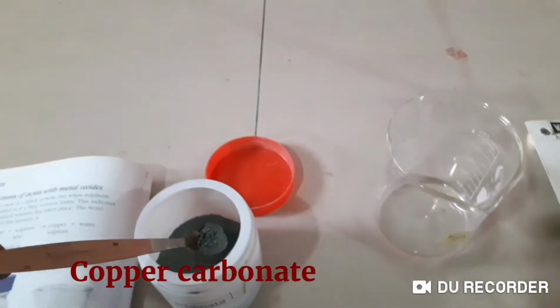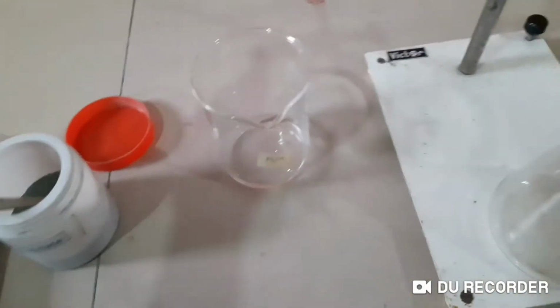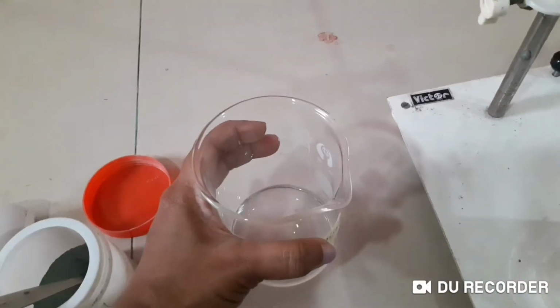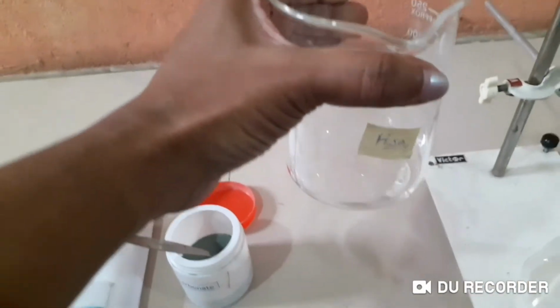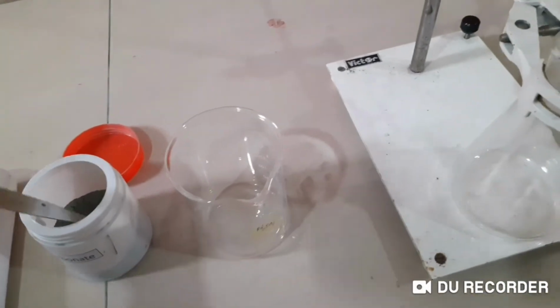I'm going to take copper carbonate and add a little bit of extra. I'm going to add into this sulphuric acid. We have a little too much, right? Okay, I emptied it a little bit and made it a small amount of sulphuric acid, so I'm going to take excess of copper carbonate and let the reaction happen.